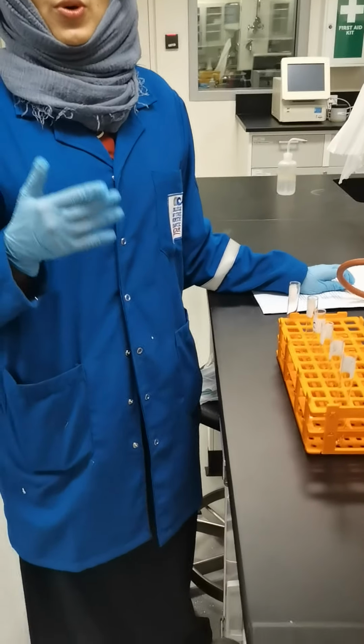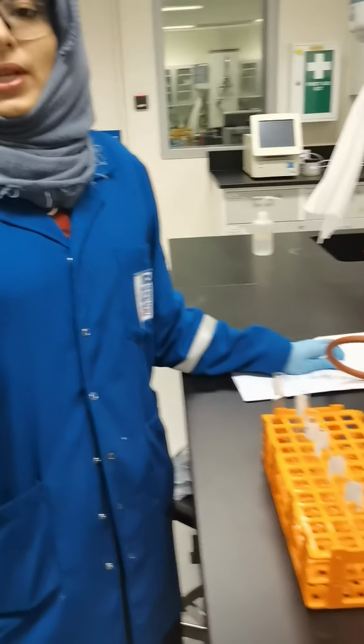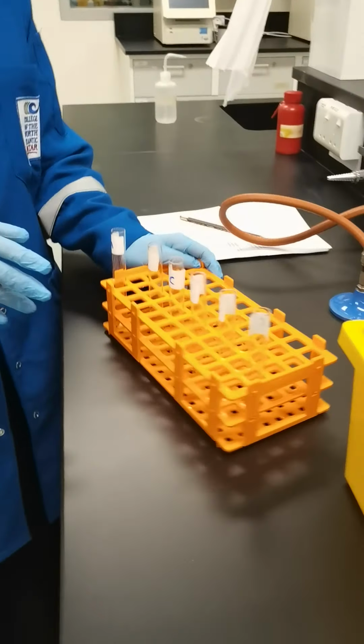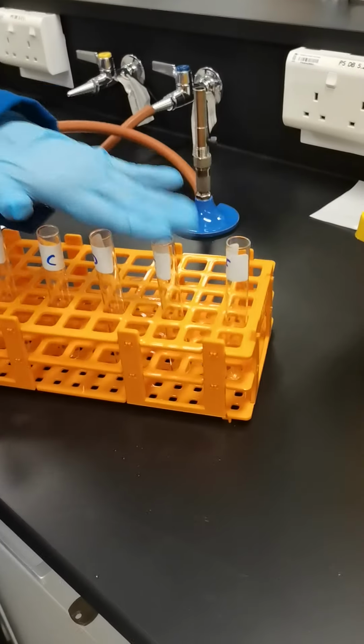Hi, today in this lab we are going to find out the stoichiometry of the reaction, the yield of a reaction. So in a reaction, one of the reactants will react with a given amount of another reactant. So we find out the amount of reactants reacted and the amount of products formed. From that we find out the stoichiometry of the reaction, and from that we can develop the chemical reaction equation for that process. So for this purpose, we have taken 6 test tubes labeled A, B, C, D, E, F.